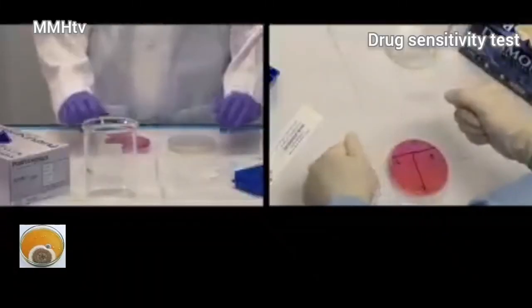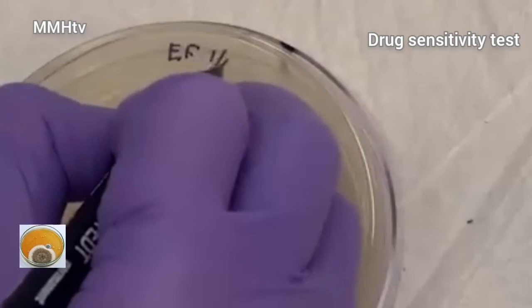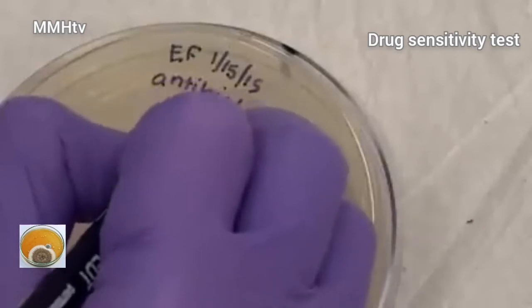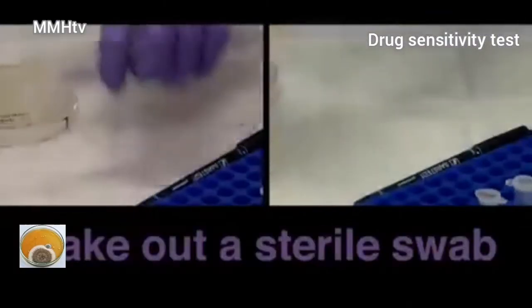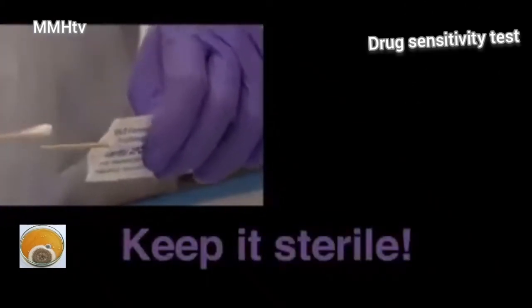What do you do then? Put on the gloves, and label the petri dishes at the bottom by writing the initials of the plants that you are testing. Take the sterile swab stick and draw a black dot on one side of the stick. This helps you to know which side of the stick is inoculated.